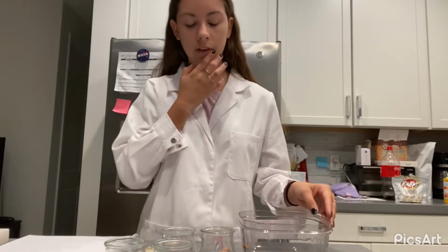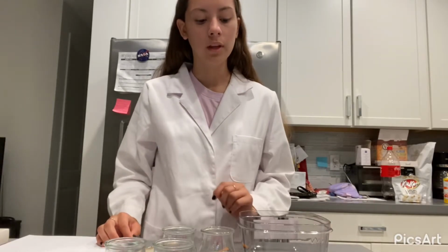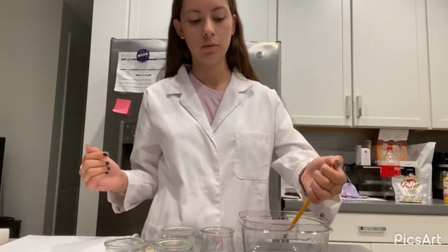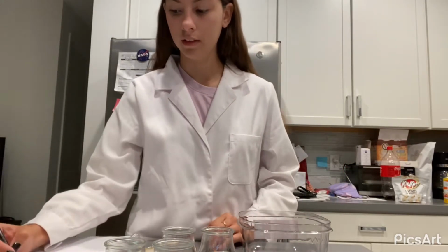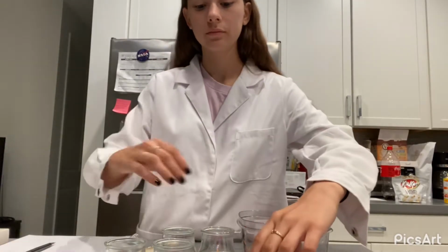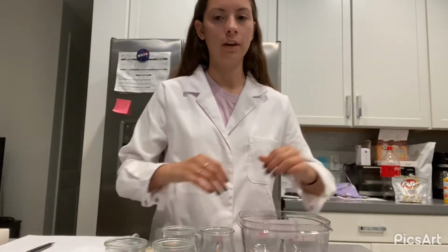Now we're gonna prepare an ice water bath using a 250 milliliter beaker. We're gonna fill it halfway with ice and some water just to cover the ice. We're gonna record the temperature of our water bath, and it's at 0 Celsius. We're gonna place our 2 low temperature test tubes inside our water bath for at least 5 minutes.